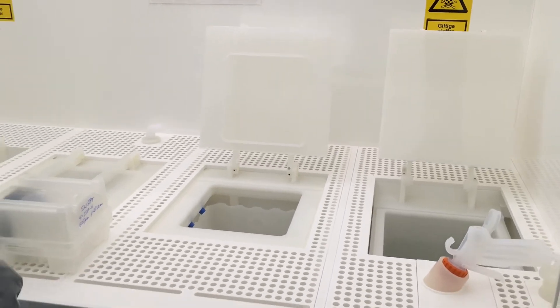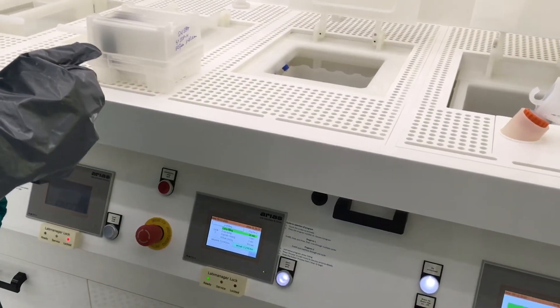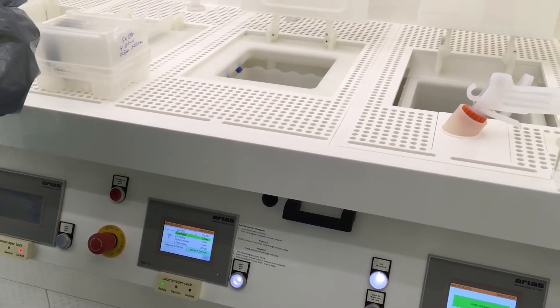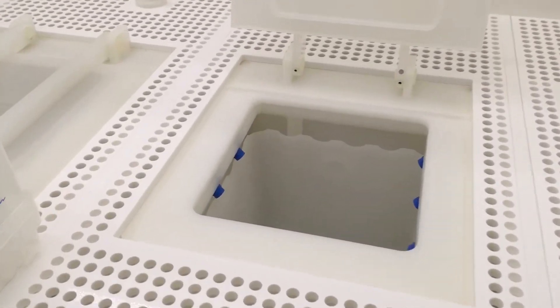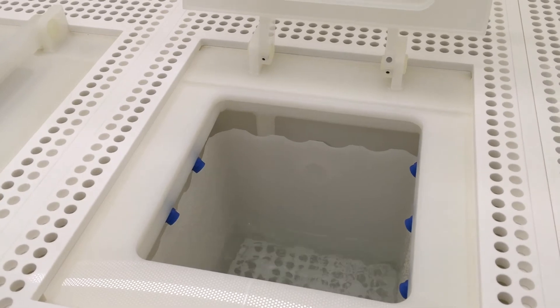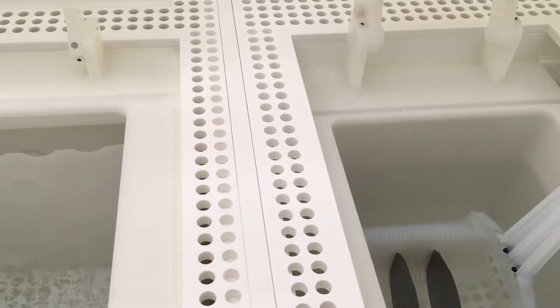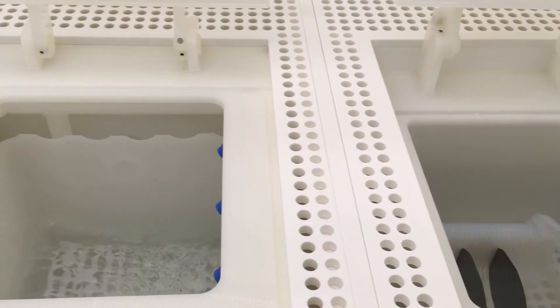Right next to it we have a rinse bath that will fill with water. After the wafers have been in the acid, you can move them to the rinse bath.